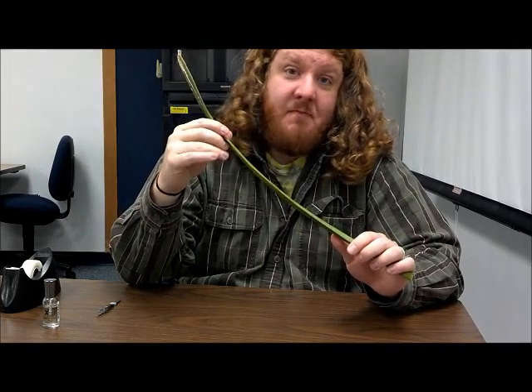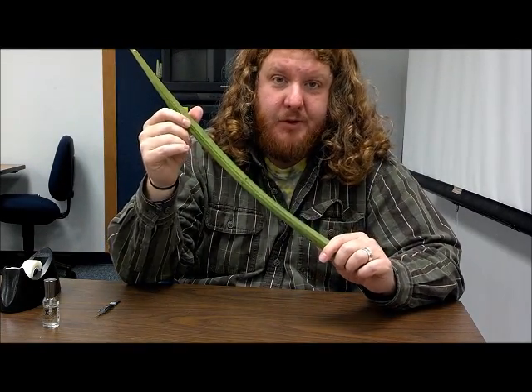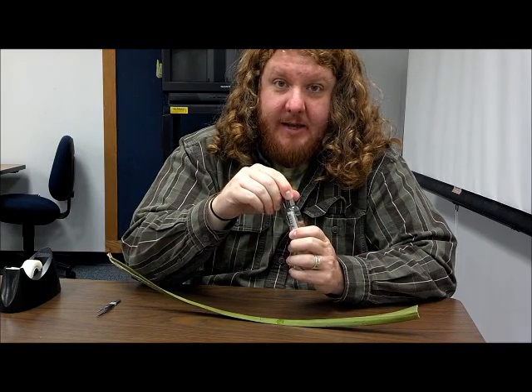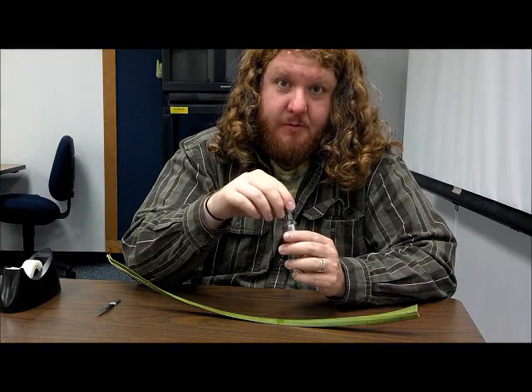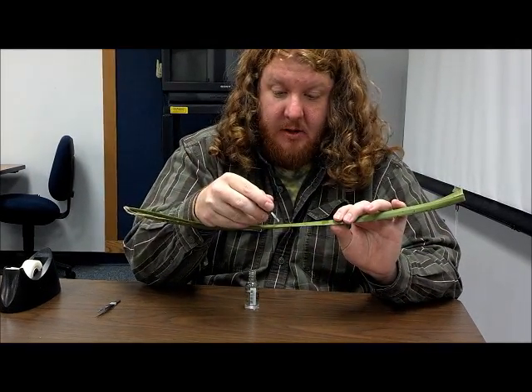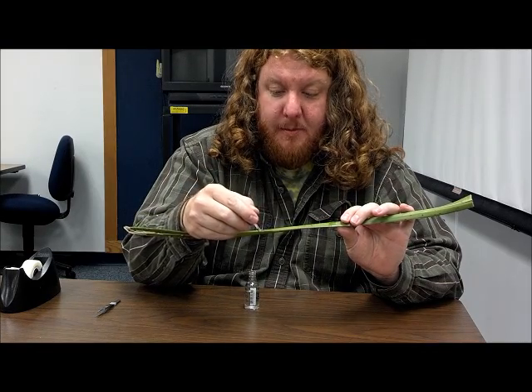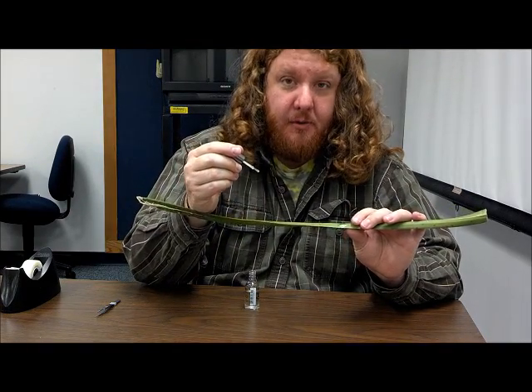This technique is very simple and very useful for a plant scientist. So let's get right to it. All we need to do is take some clear nail polish — it's helpful if it has ethyl acetate in it, but just about any nail polish that's clear will work for our purposes. All we need to do is paint a little section of the leaf, probably one centimeter by one centimeter, which would be a good sample size. That'll make it easy for us to do our count later on under the microscope.